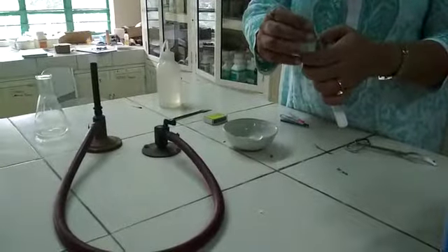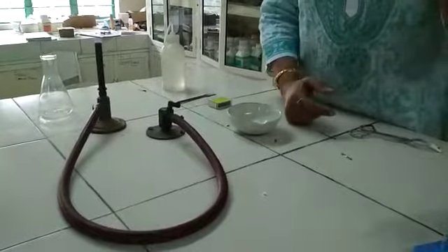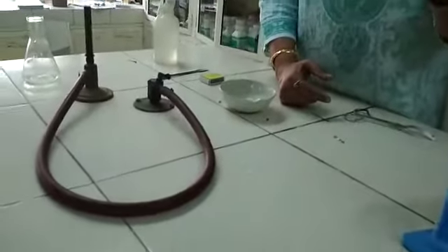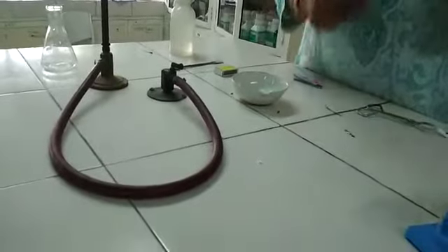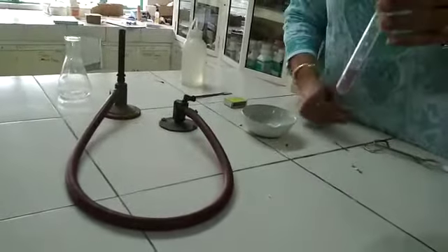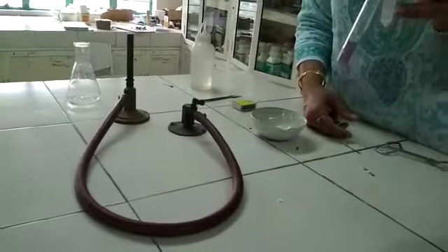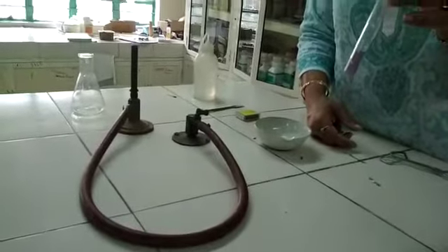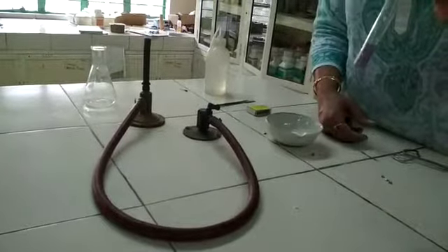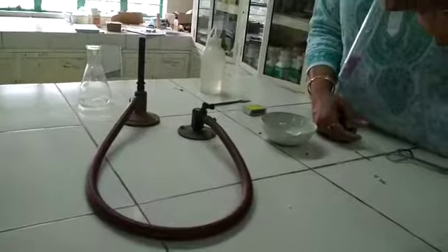Litmus is an indicator which changes color with acidic and basic solutions. The blue litmus remains blue, and the red litmus changes to blue. We know basic solutions change the color of red litmus from red to blue. So we can say metallic oxides are basic in nature.